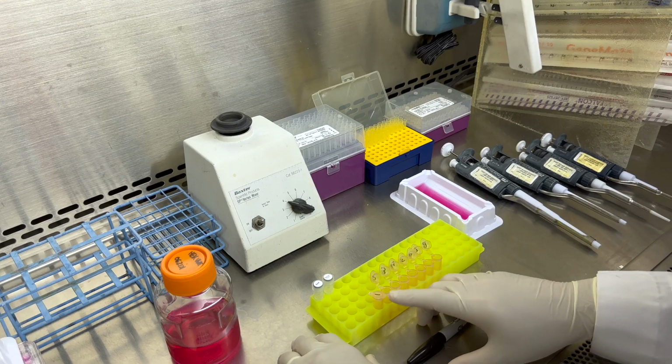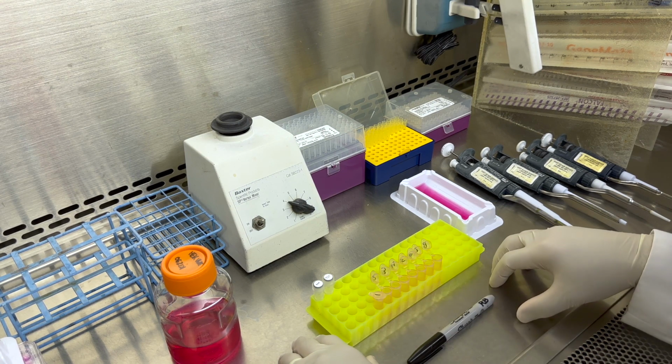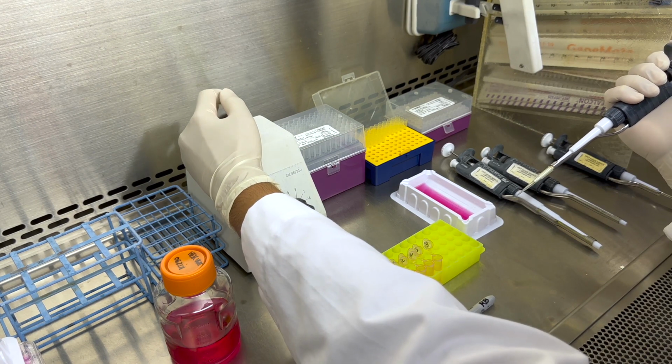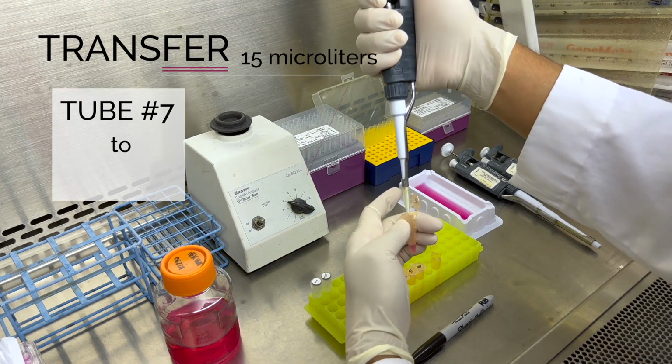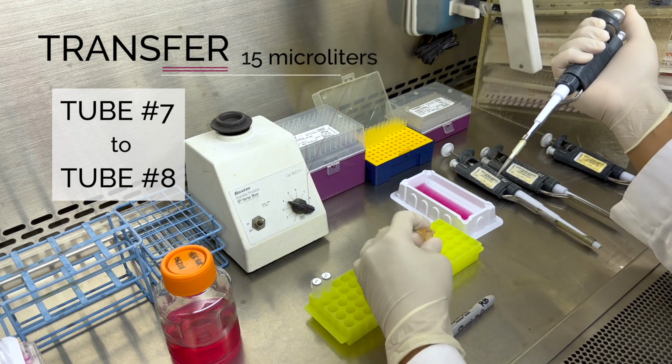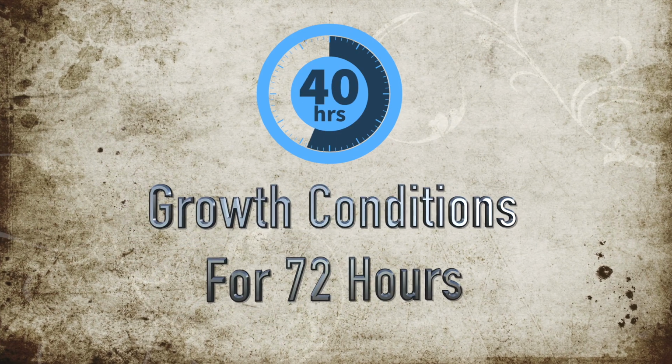We need to transfer 15 microliters from tube number 1 into tube number 2 and repeat this transfer into each subsequent tube. Vortex briefly before each transfer. Finally, transfer 15 microliters from tube number 7 into tube number 8. We will transfer the plate into the appropriate growth conditions for 72 hours.